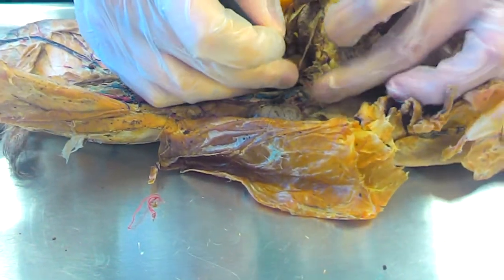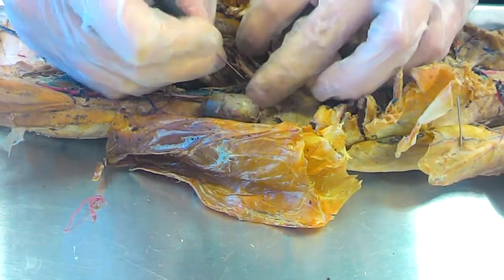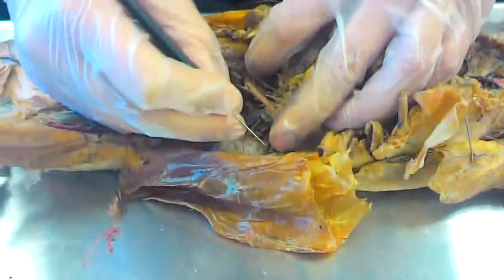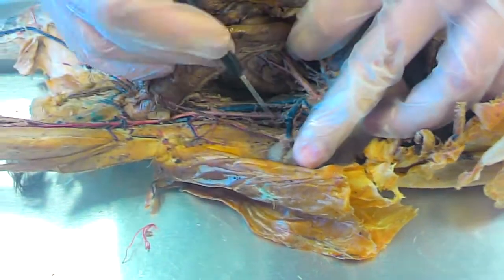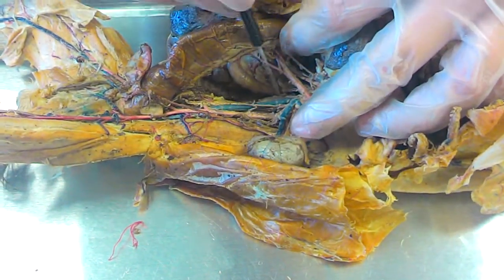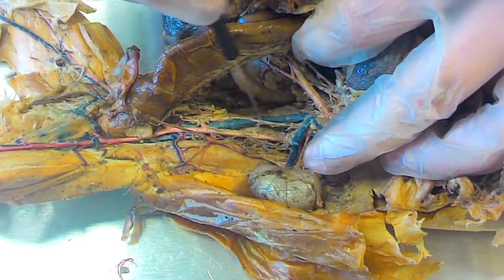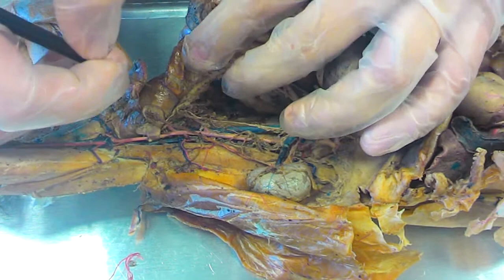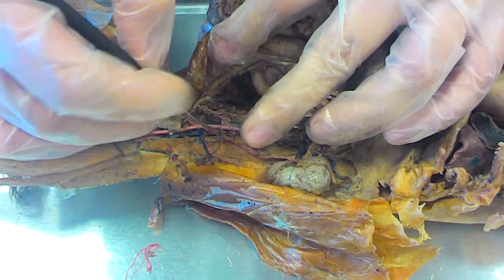After you have the celiac trunk, then you have the superior mesenteric, which goes to the top part of the intestines. You have the renal vein and artery, the adrenal lumbar vein and artery, which would be right here if our adrenal gland was still attached to the kidney. Gonadal comes off of the renal. You keep going down and you have the descending aorta and the inferior vena cava. You get to here, and the one that connects to the bottom part of the intestine is the inferior mesenteric. Then you have iliolumbar.